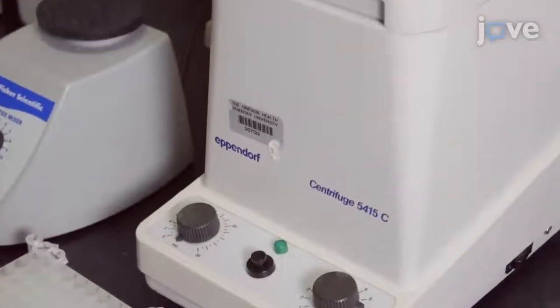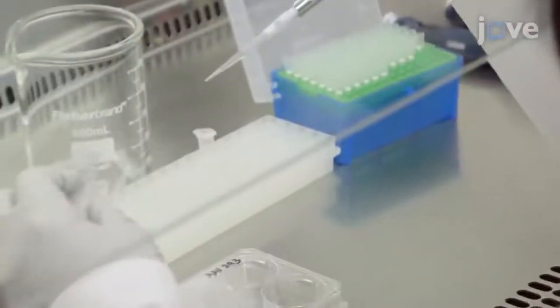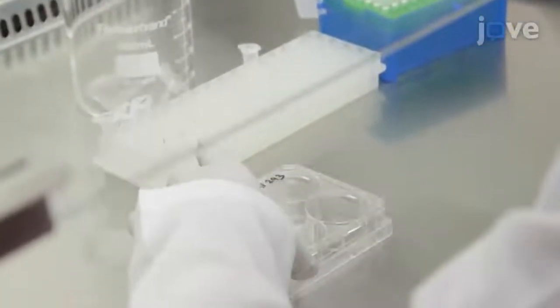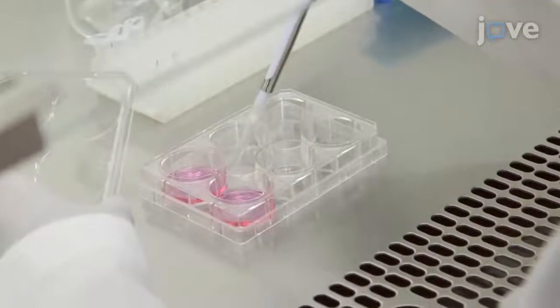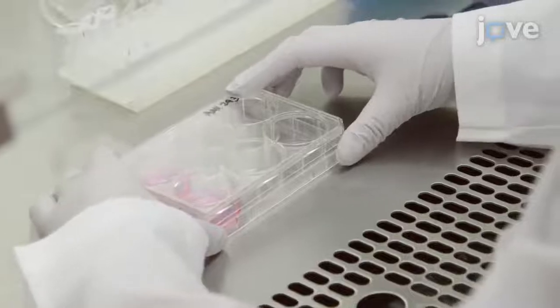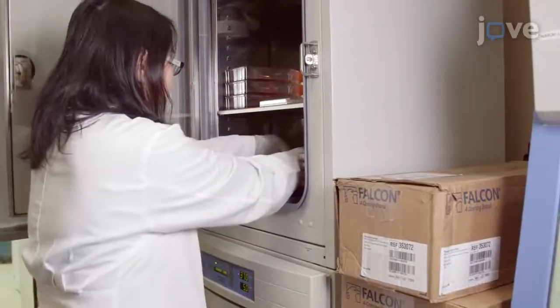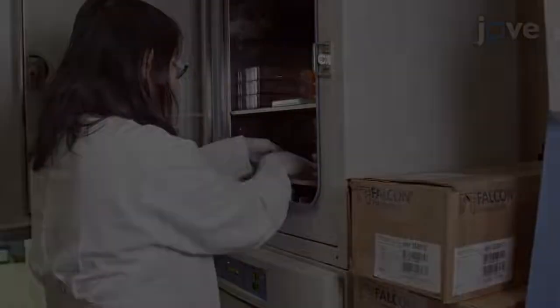Following the incubation, briefly spin the tubes in a microcentrifuge to collect the liquid at the bottom, and add the DNA PEI mixture dropwise to the culture medium in each well of the HEK293 culture plate. Then gently agitate the plates and return them to a 37 degrees Celsius incubator with 5% CO2. Transfection.